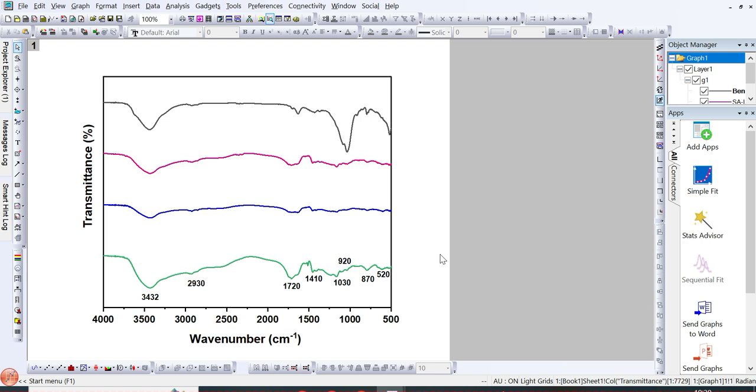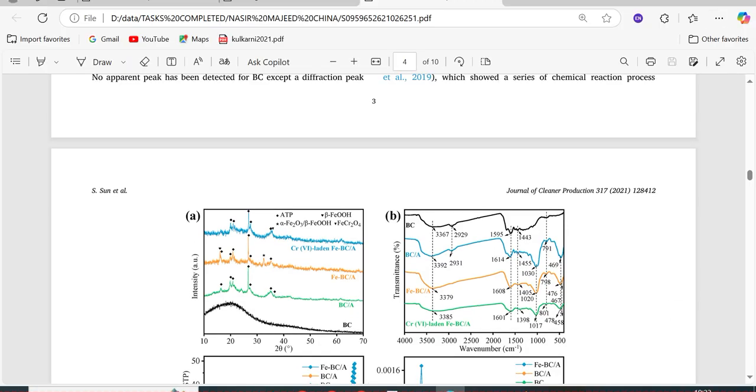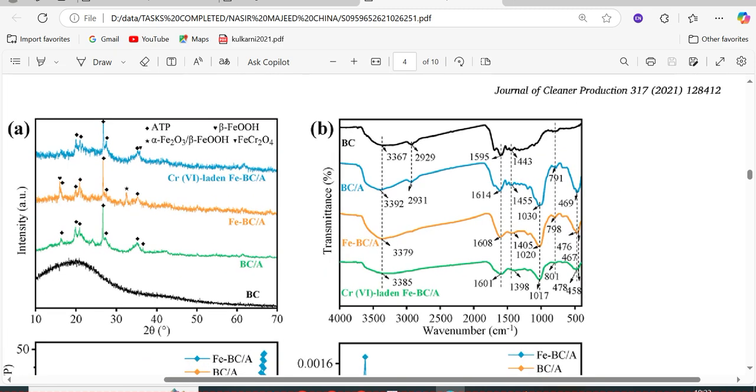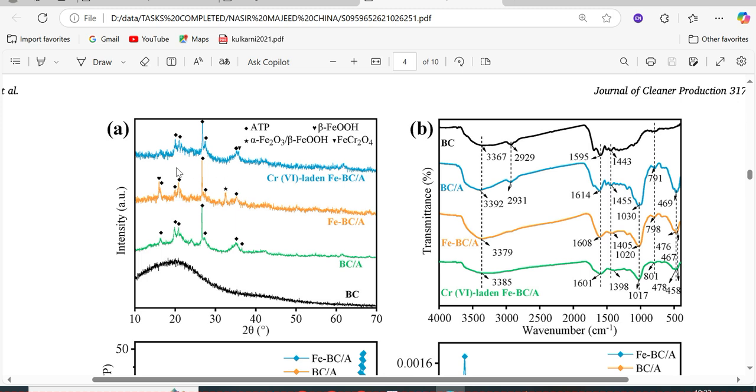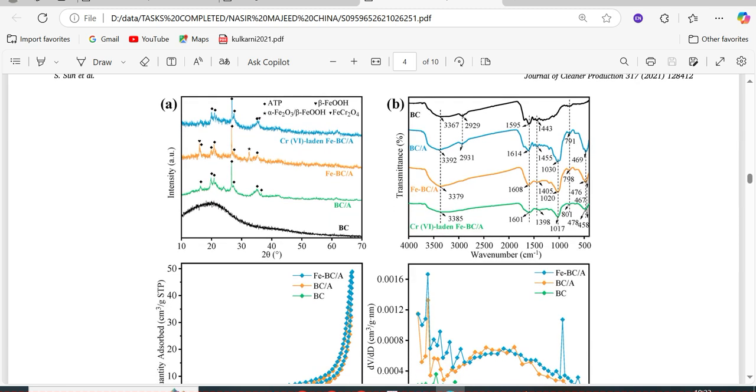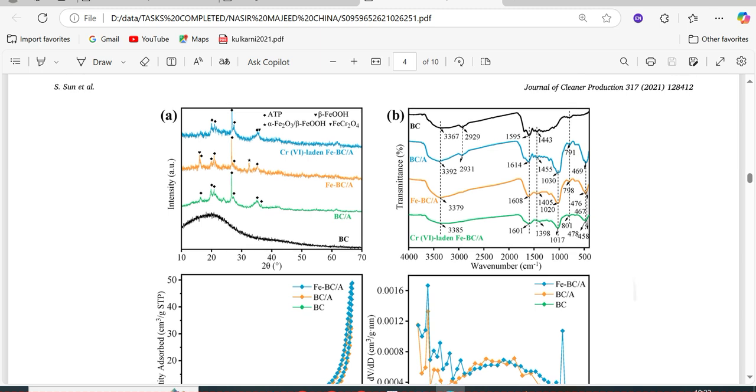papers from well-reported journals like ACS and Springer or elsewhere, where they have plotted such kind of graphs. So here you can see this kind of FTIR spectra, where they have kept the space between each line, and they mention the wave number, and they also label each spectral line carefully. So this type of spectra looks more reasonable and attractive, and this kind of XRD as compared to overlapping FTIR and XRD spectra.